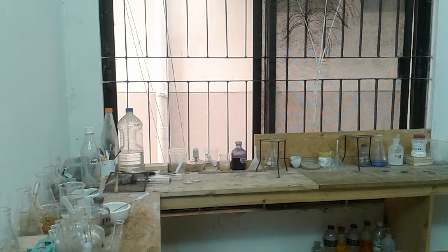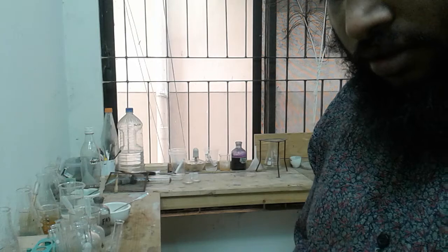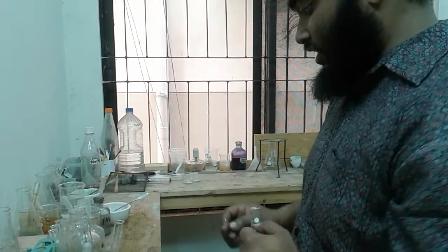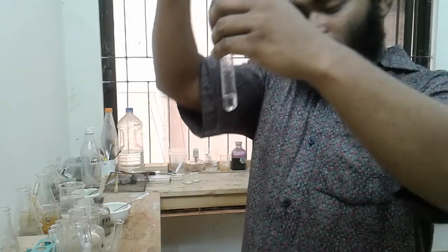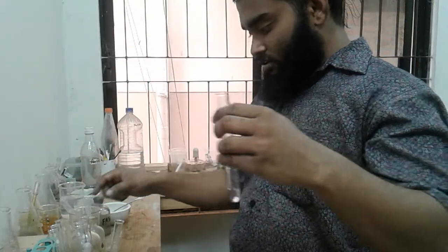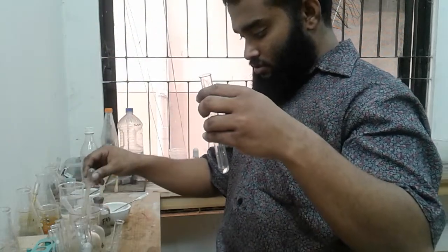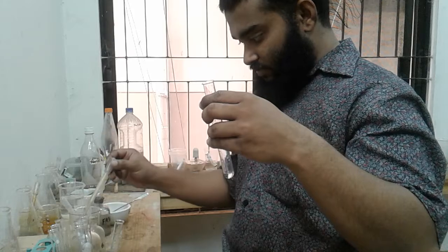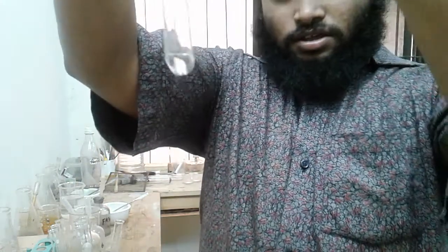Now Fa3A with Fa3C. First let me take Fa3C, just reducing the amount. Sorry, it's Fa3C I've taken. Now I will be taking Fa3A.